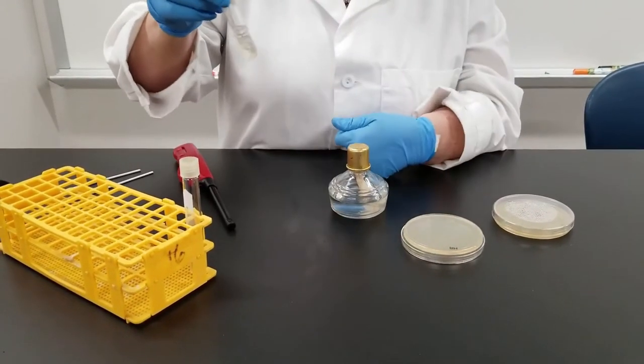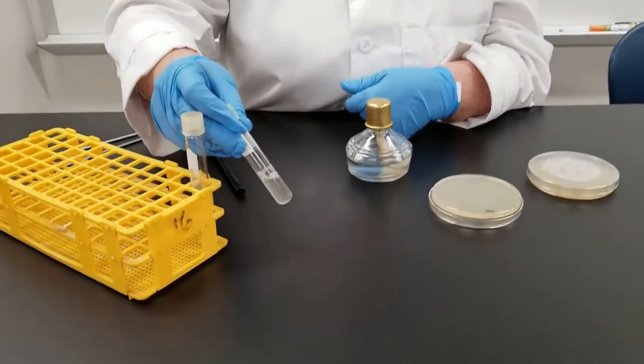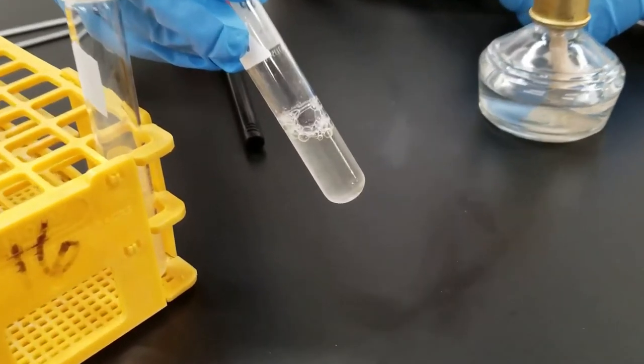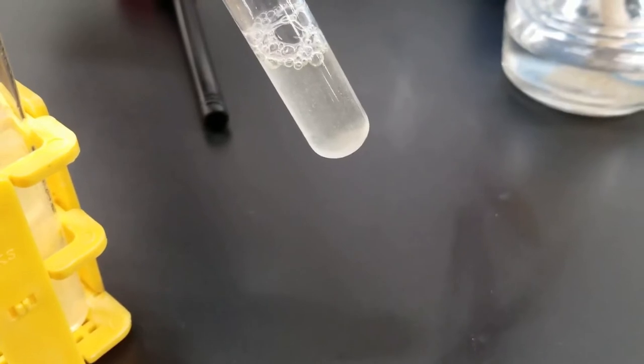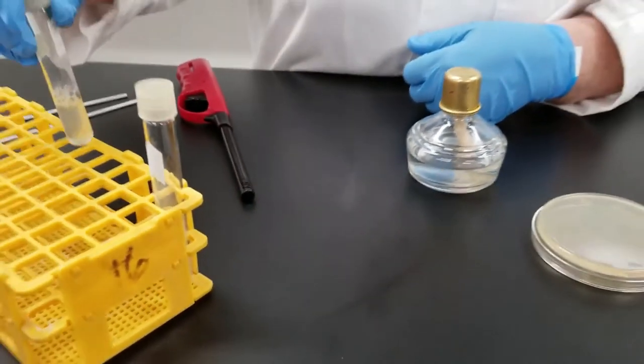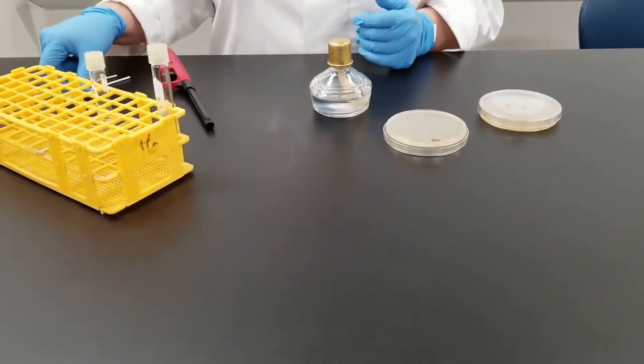Usually when it's in liquid, bacteria will turn it cloudy, slightly cloudy. I don't know if you can tell that that has some particles in it. That's the bacteria that was grown for about 24 hours. And so today what we're going to do is show you how we transfer from one medium to another.